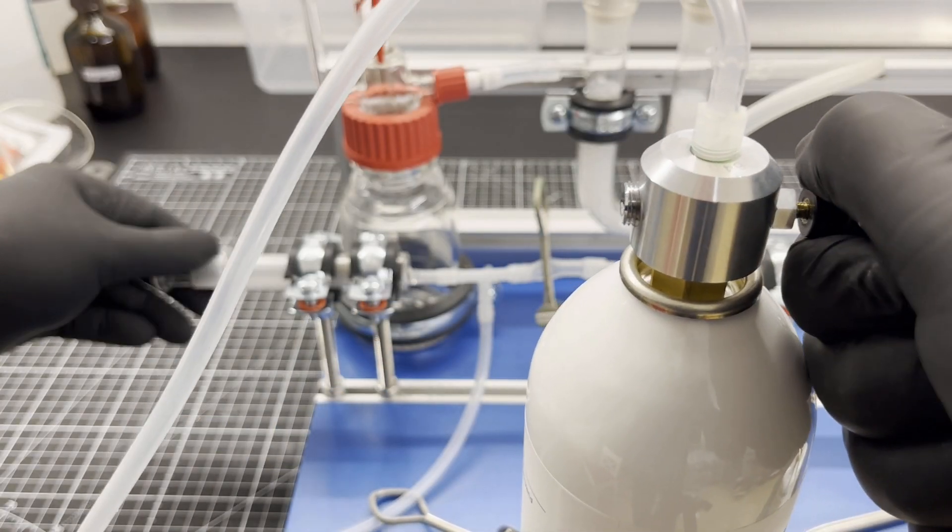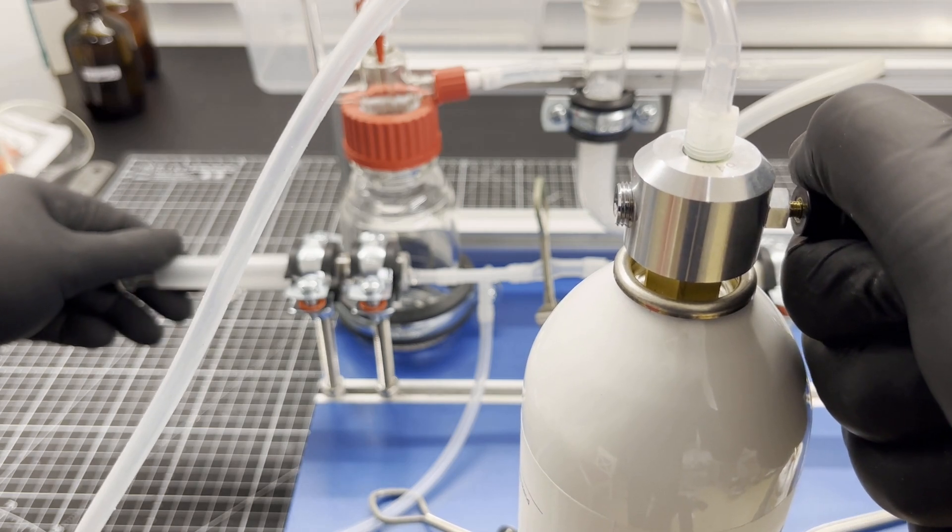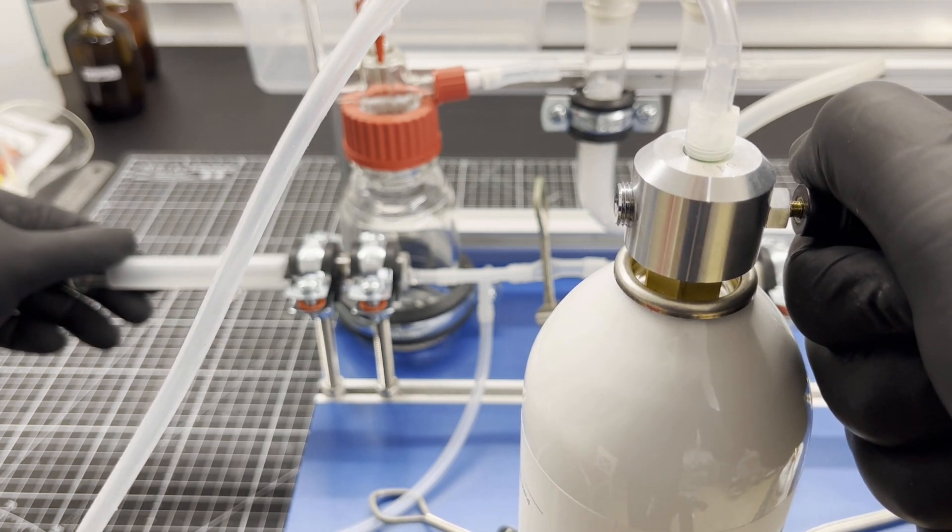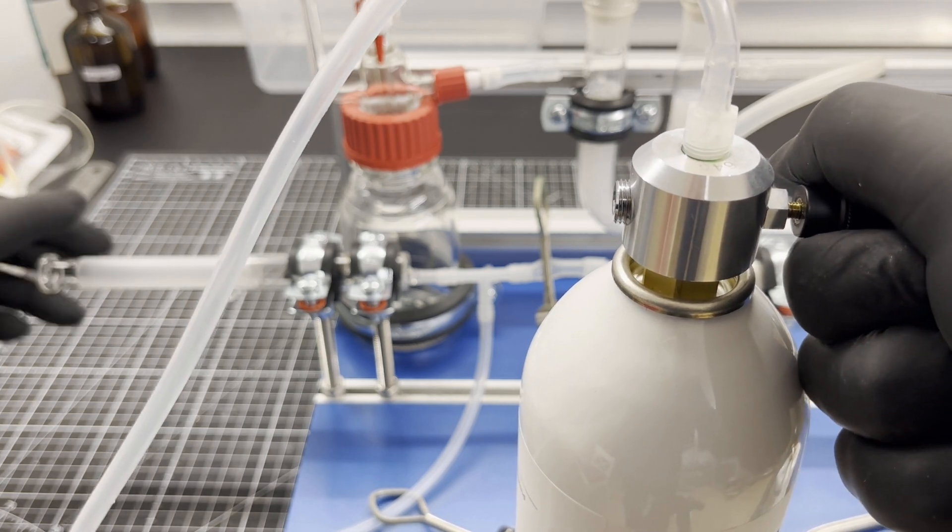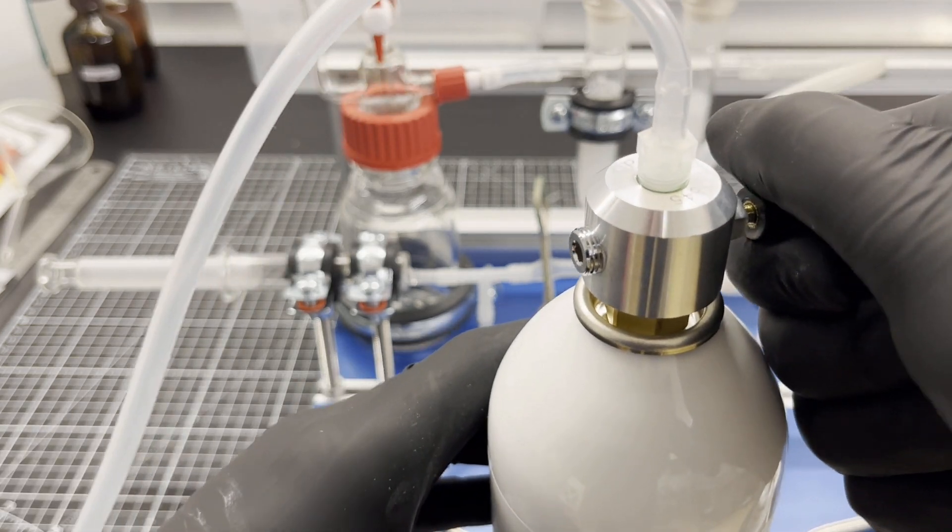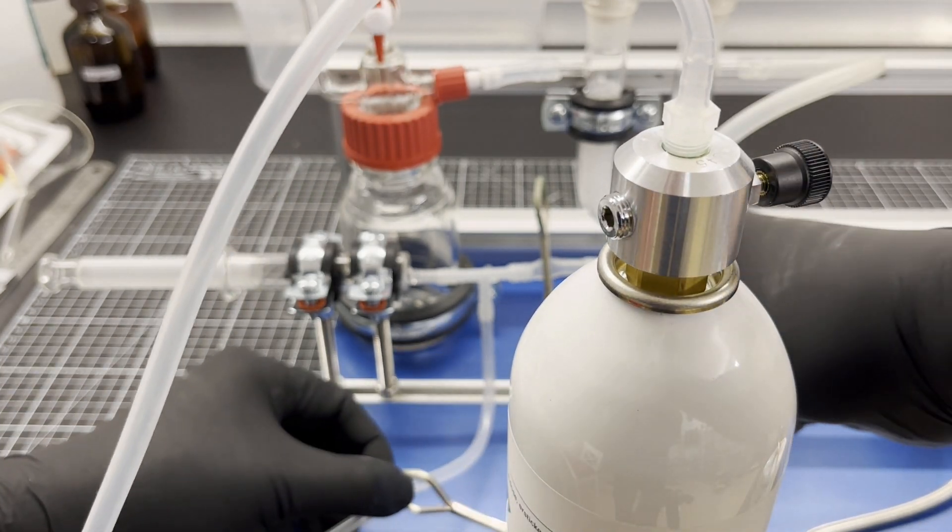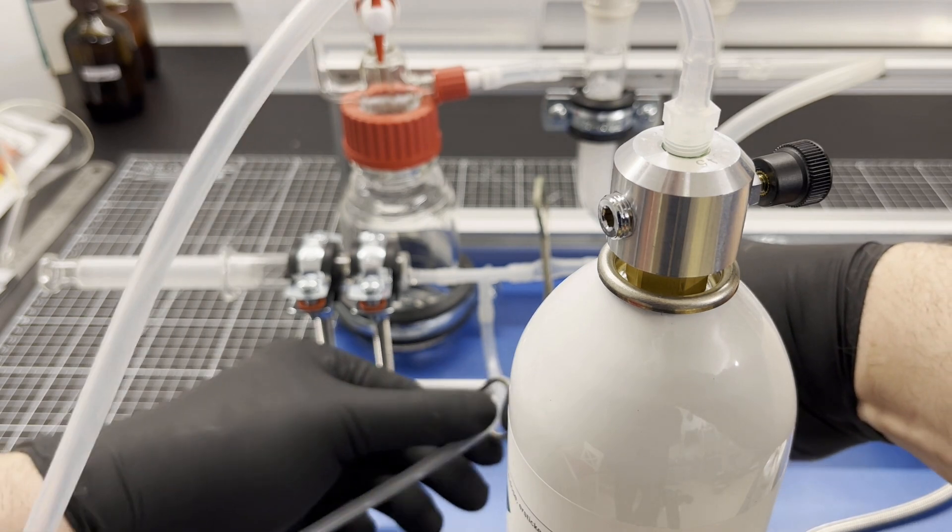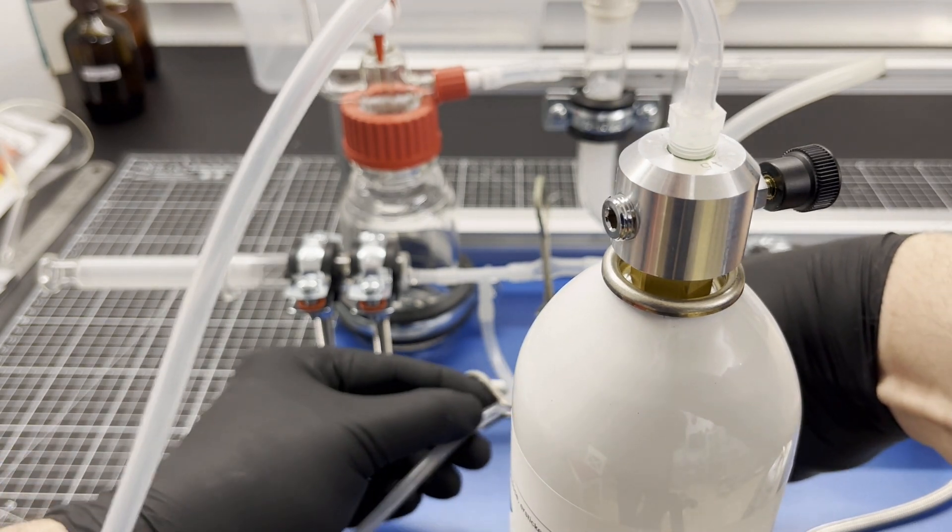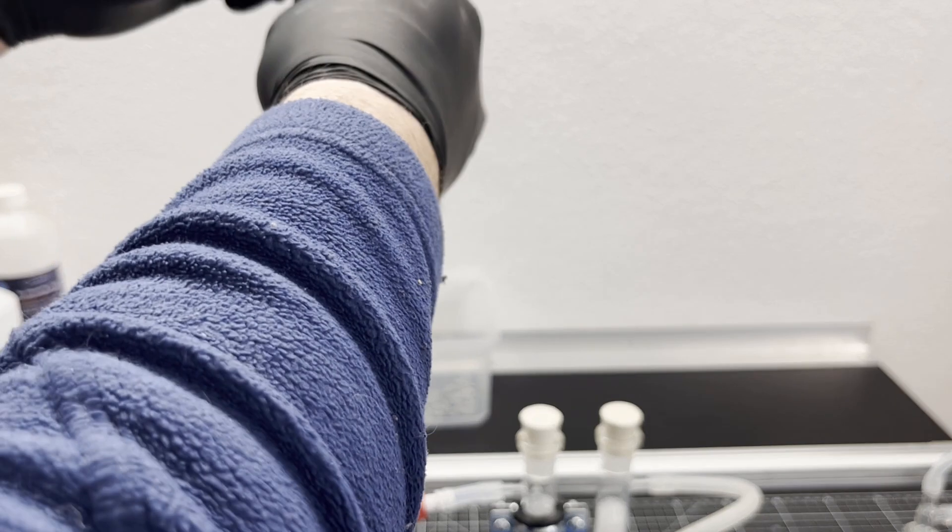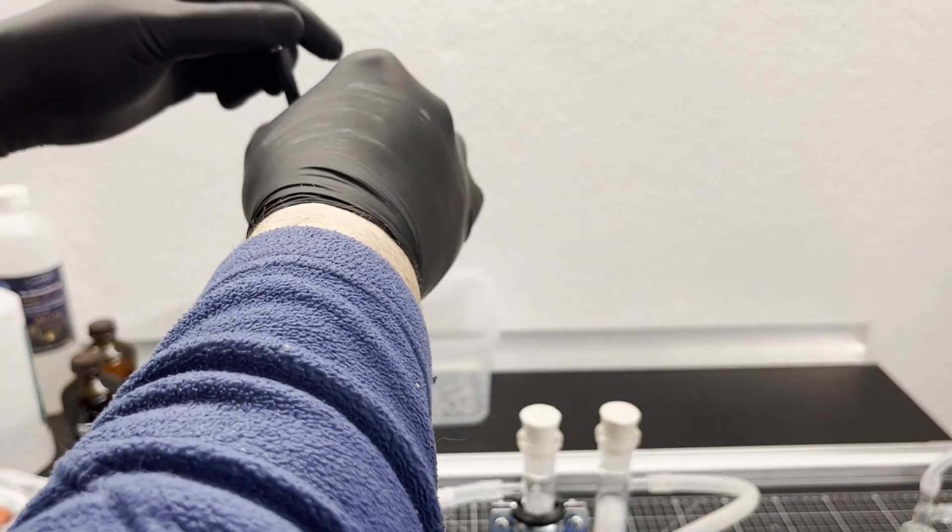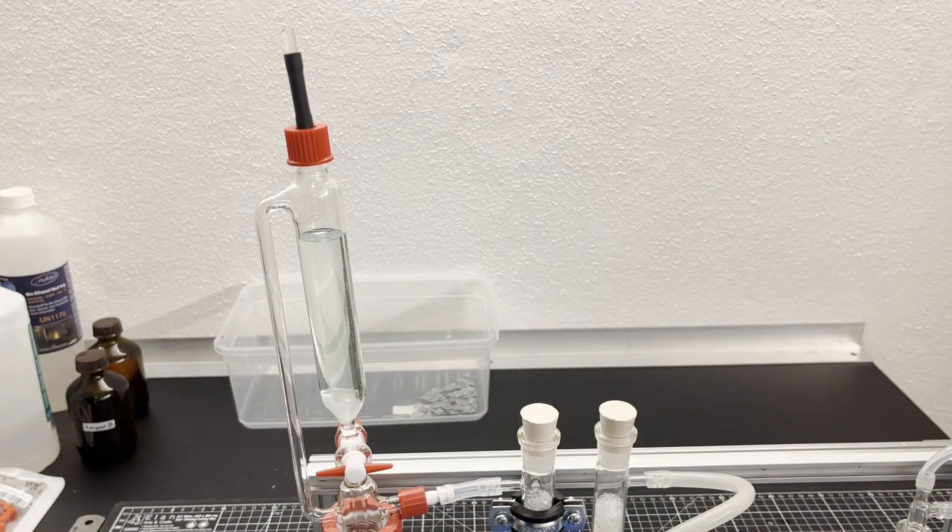The gas syringe is now carefully filled with pure nitrogen and the pinch valve is closed. As a final preparation before synthesis, the gas generator's dropping funnel is filled with the sulfuric acid.